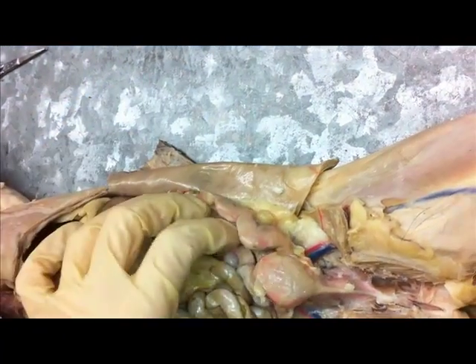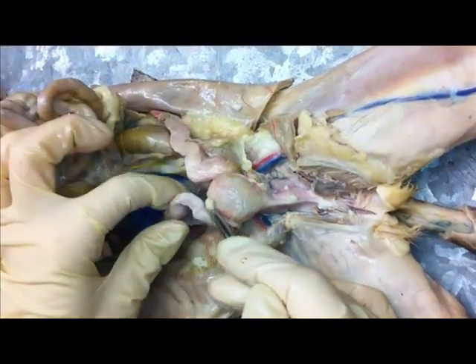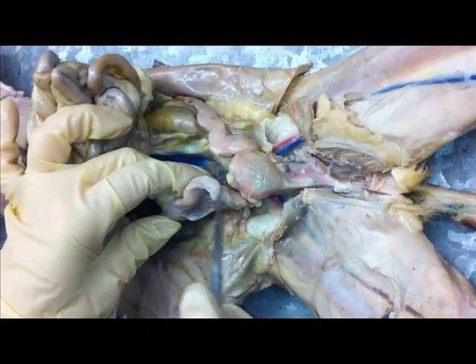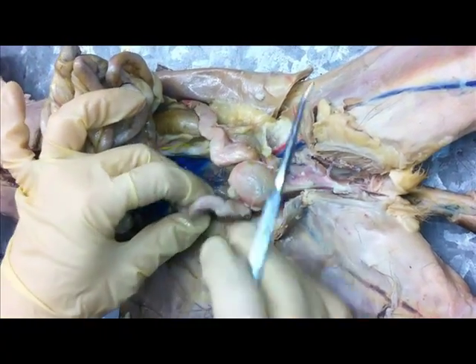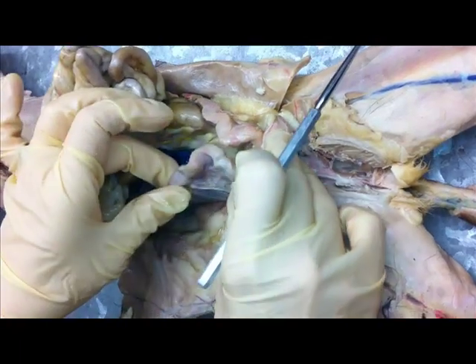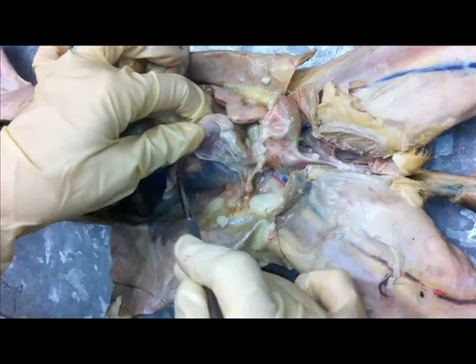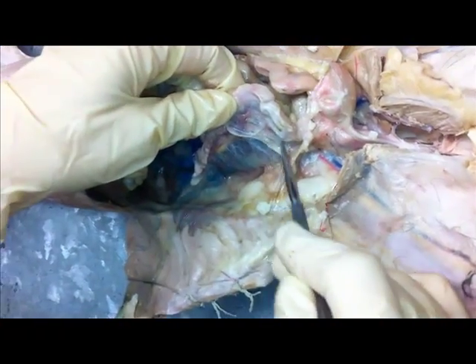We have another uterine horn on the other side, so it's this kind of convoluted looking tube. And more broad ligament — there's the broad ligament.